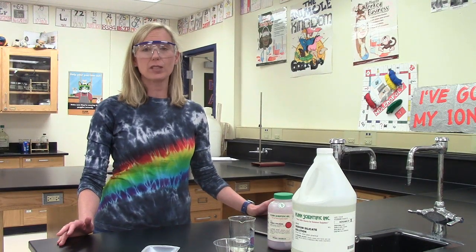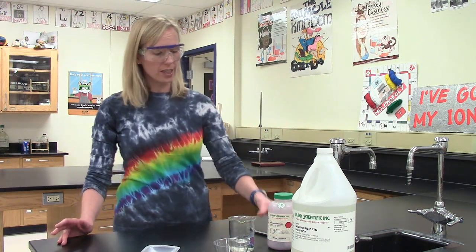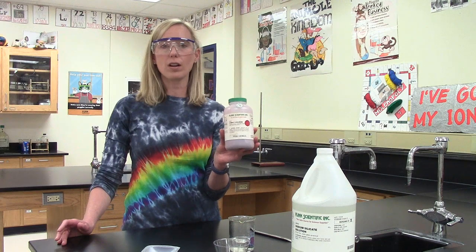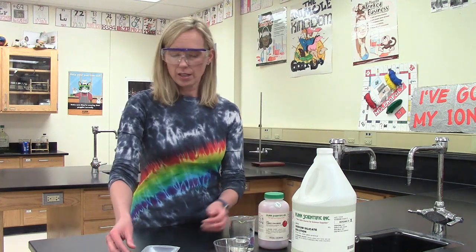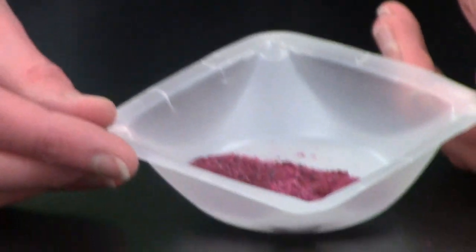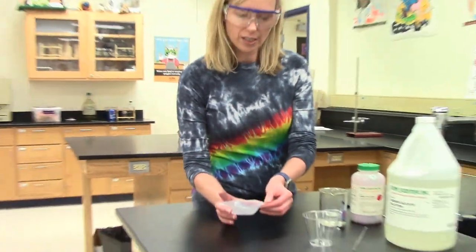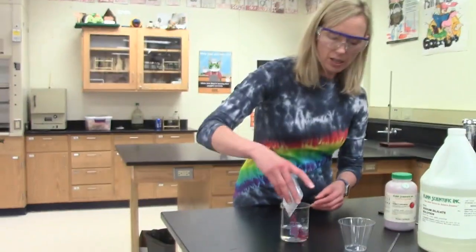In our next chemical reaction, I'm going to show you a demonstration of a double replacement. Here are the chemicals that I'm starting with. My first reactant is a solid chemical called cobalt-2 chloride. If you zoom in and take a look at this, it's a really pretty pink color, but right now it's in the solid state. So I wanted to show you what I'm going to do with this. I'm going to take the solid cobalt chloride, and I have some deionized water, and I'm going to put that in there.